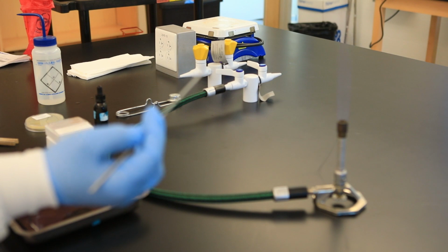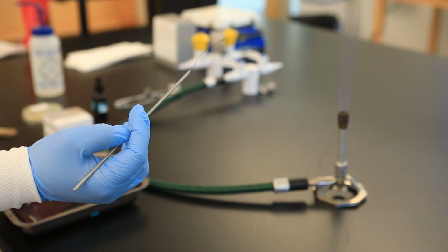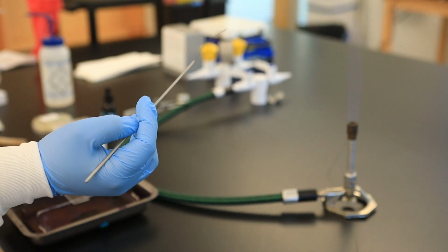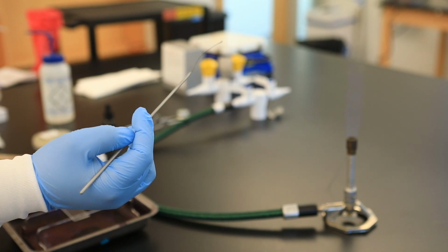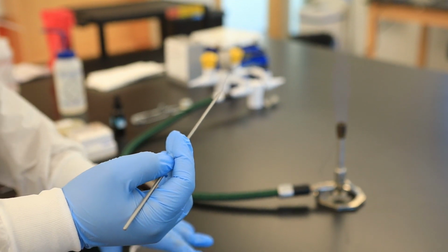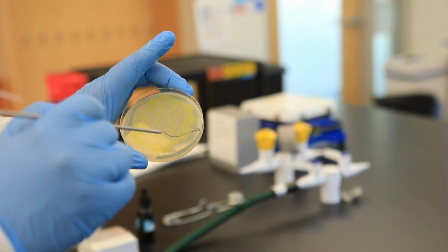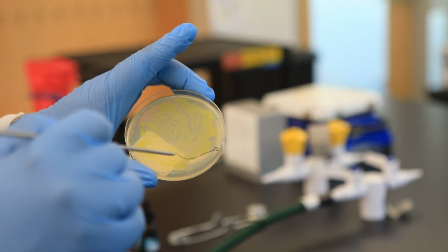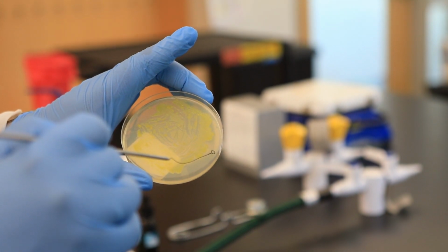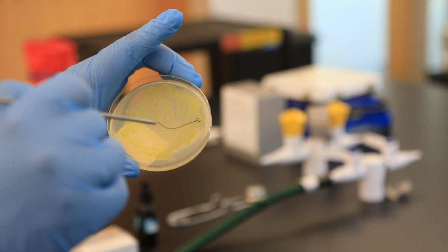Once you sterilize the inoculation loop, you have to allow it to cool. So we don't wave it around, we don't blow on it, right? Because that defeats the purpose of trying to prevent contamination. So we allow it to cool, usually for 30 seconds or so, okay? But let's say if you are a little bit impatient, what you can do is you can take the loop portion and place it onto an area of the agar where there's no bacteria to allow it to cool. Okay, so that's what I'm doing now to allow it to cool. Now I'm going to be ready to get the bacteria.